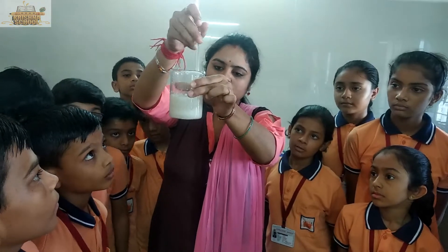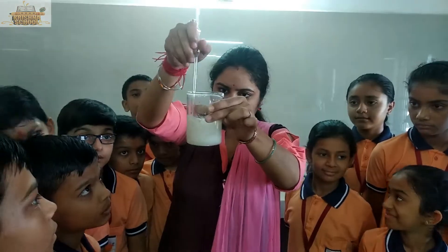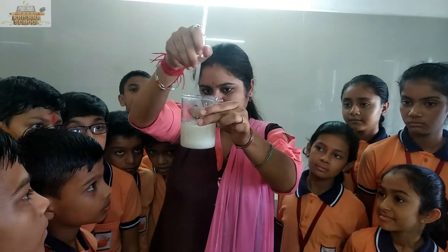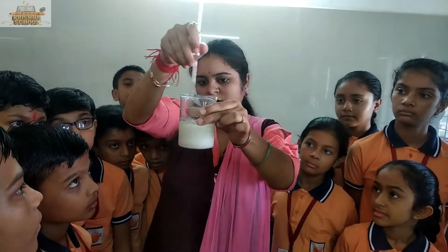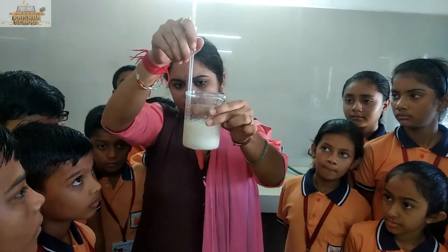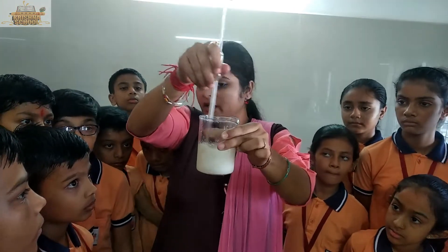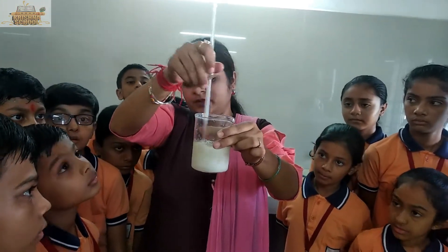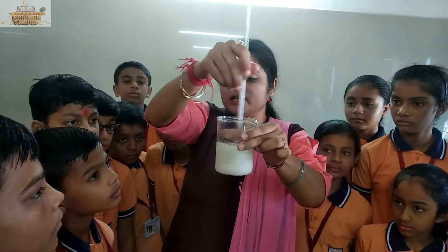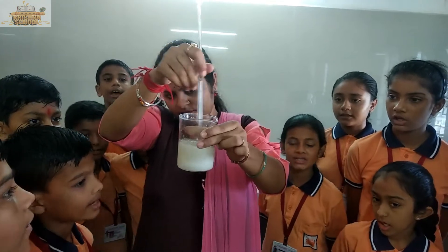Can you see some salt particles? These salt particles are dissolving in water. After some time, a situation comes when these salt particles stop dissolving in tap water, and at that point we say that this solution is a saturated solution.